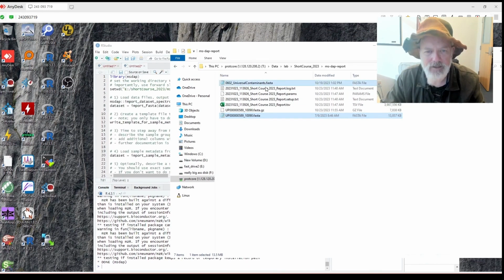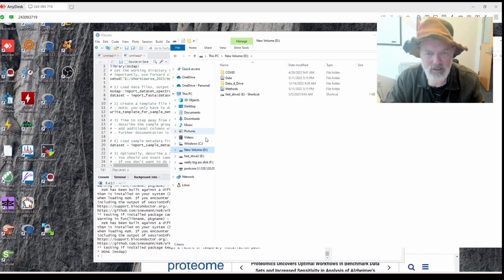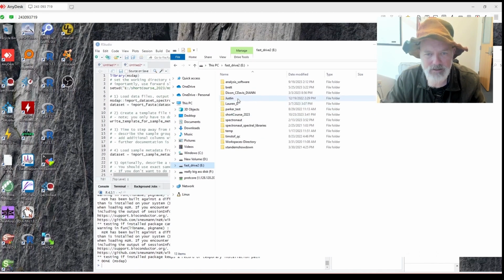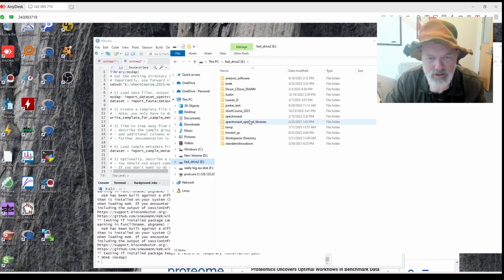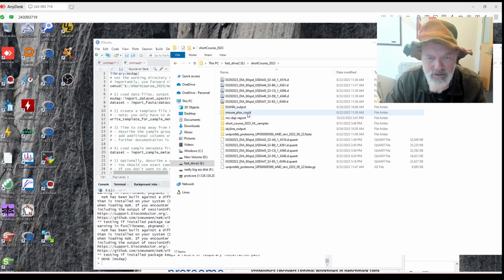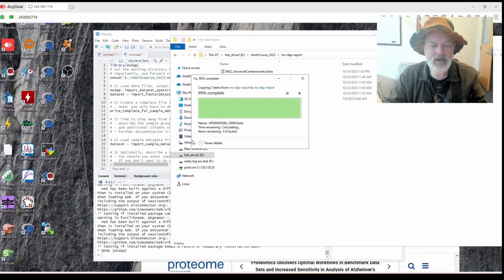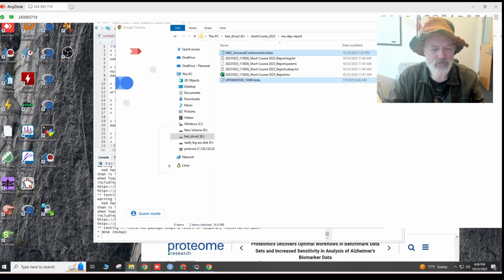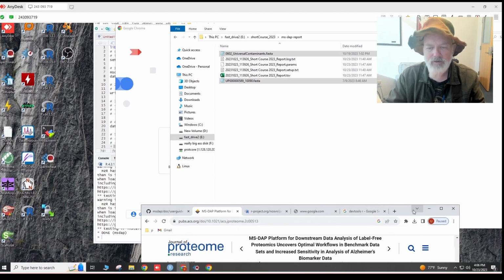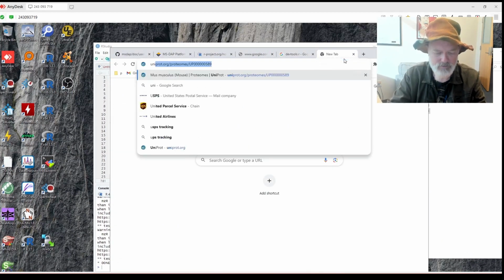Okay, so I'm going to copy the two FASTAs and put them into my... where's this? I had it. Short Course 2023 MS DAP report. Okay, I'm going to paste those in here. And so where I got those, by the way, so we're using mouse liver and no, stop. And so the one I use, just for reference, is I used UniProt.